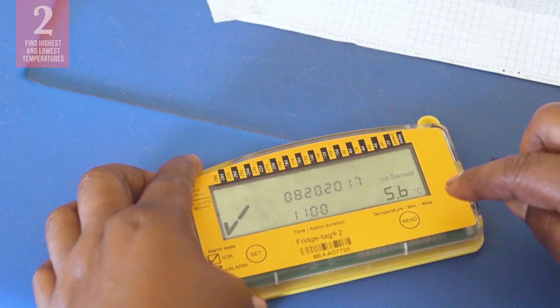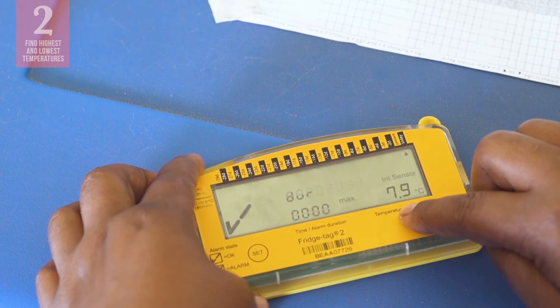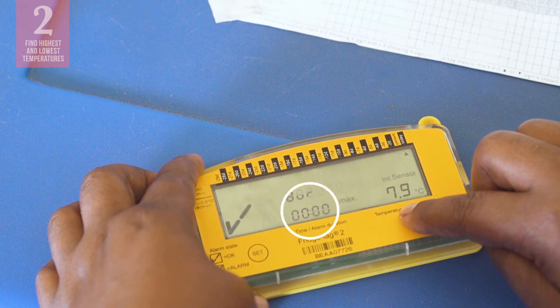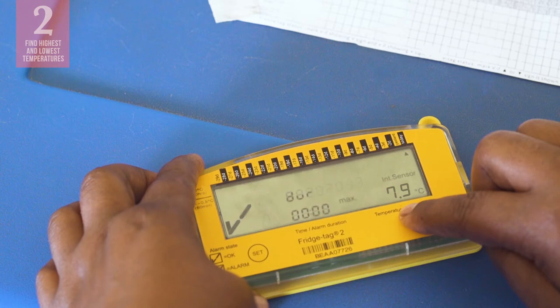Let us do a temperature reading. On this fridge tag, the current temperature is 5.6 degrees Celsius, which is within an acceptable range. If we push the Read button once, we see that the highest temperature today was 7.9 degrees Celsius. Here, you will notice that the display shows a zero. Remember that this number shows you the amount of time that refrigerated temperatures were too high today. Though temperatures went as high as 7.9 degrees Celsius today, this is still a fine temperature for the vaccines stored in this refrigerator — 7.9 degrees Celsius is not considered too high. So the fridge tag is telling you that refrigerated temperatures were too high for zero minutes; in other words, they were never too high.